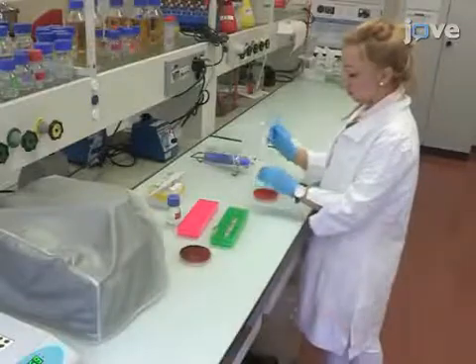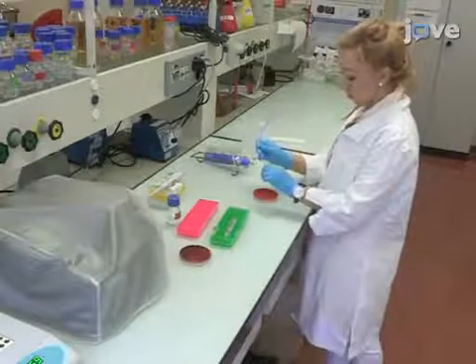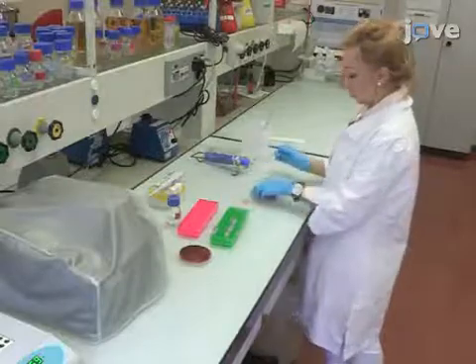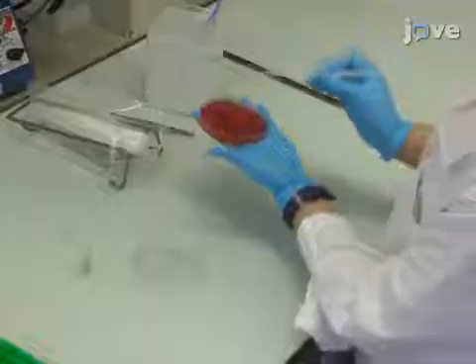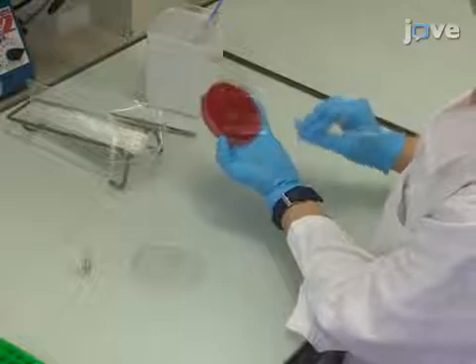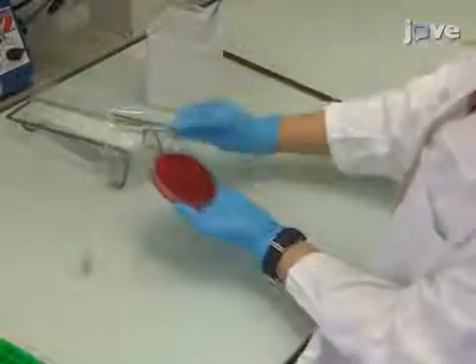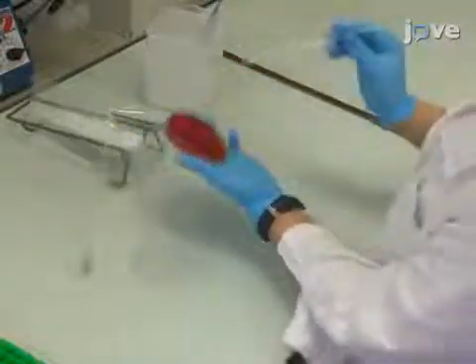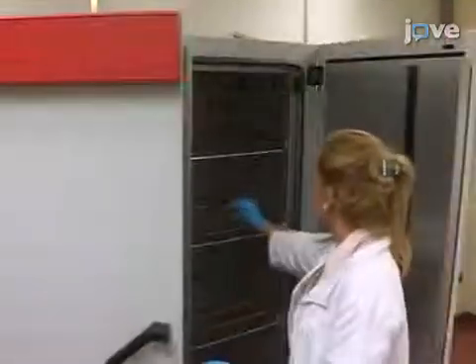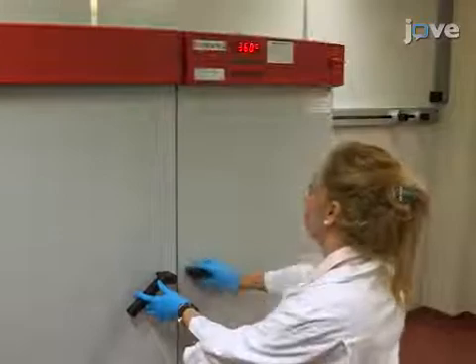To begin, spread 10 microliters of Staphylococcus aureus stock culture, or one colony grown on selective medium, on Columbia agar plates containing 5% sheep blood, or BA. Incubate the culture aerobically at 37 degrees Celsius for 18 to 24 hours.